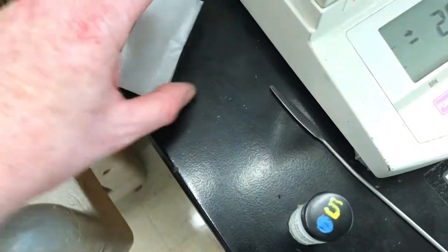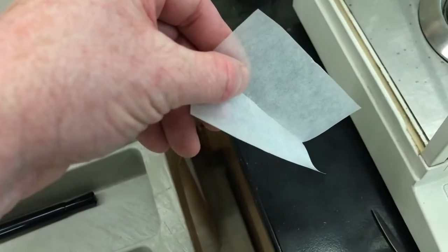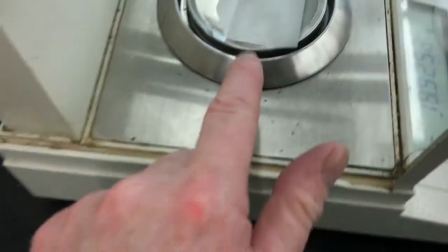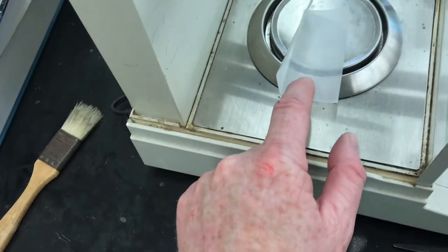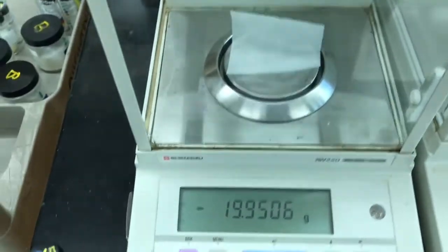So there we go, one handful. I'm going to put my sodium borohydride in here, and then I'm going to pour this into the methanol fluorenone solution to start the reaction. So first though, I'll put this wax paper on the scale, and I'll make sure my wax paper is not touching the edge, it's only on the pan. If I put it like this, it's not going to give me an accurate reading because it's resting on there. Only on the pan. It's looking good. And then I'll zero it.